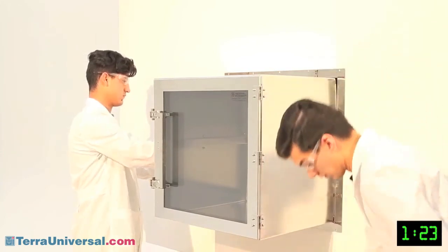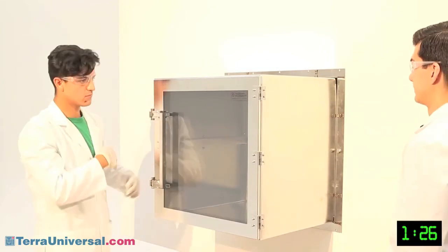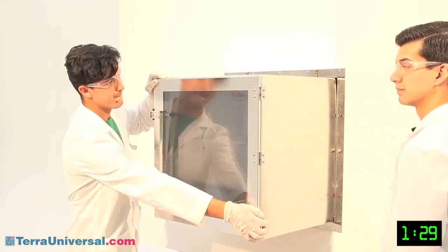Be careful not to over-tighten. The dirty side bracket should be secure against the wall, but should not bend inward.